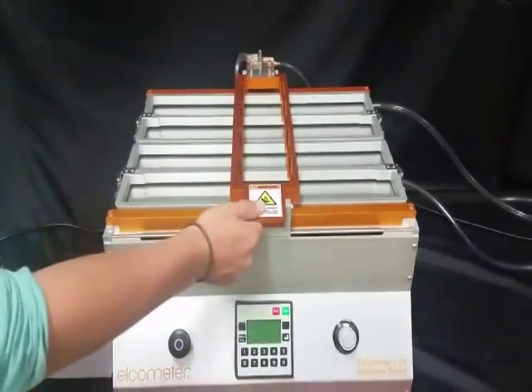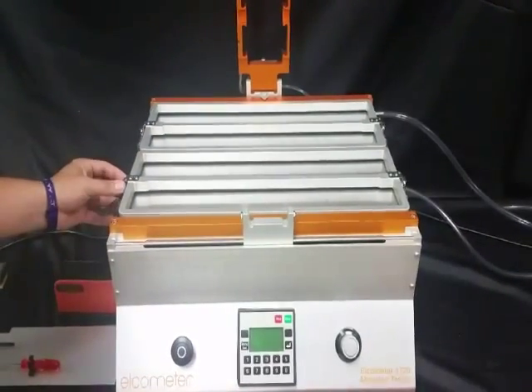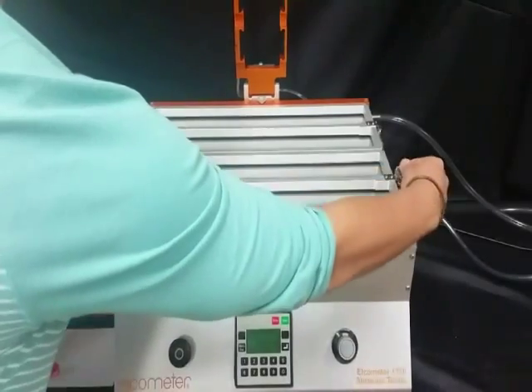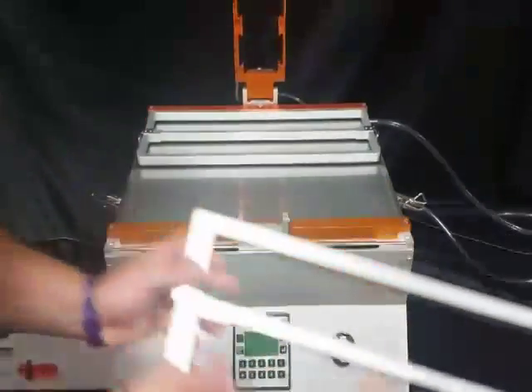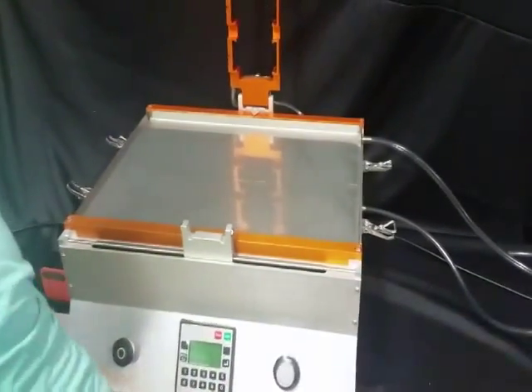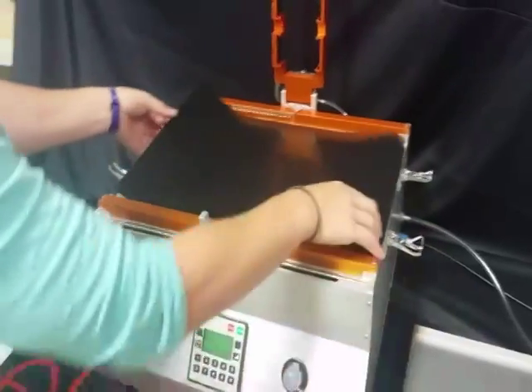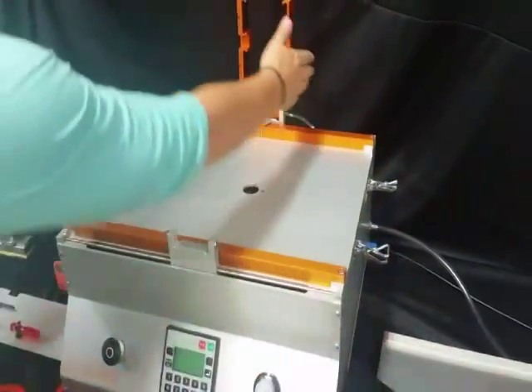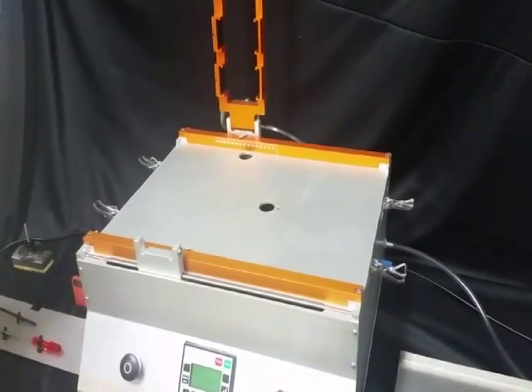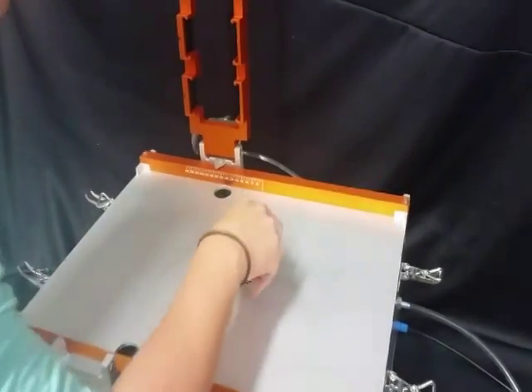Step 2 is adjusting the stroke length of the carriage. First, you will need to turn the machine off, remove the frame and the sample tray, and push the carriage to the left as far as it will go. The tools are supplied standard with the unit for your convenience. You will put the T-bar tool through hole A. This will lock the carriage in position.